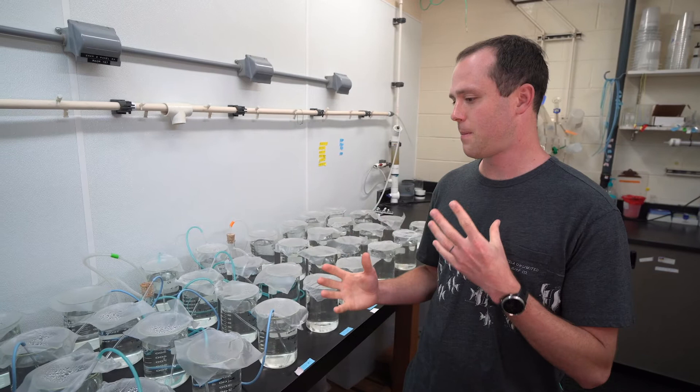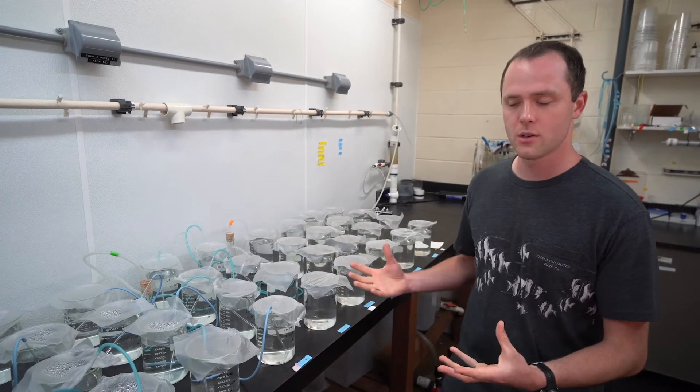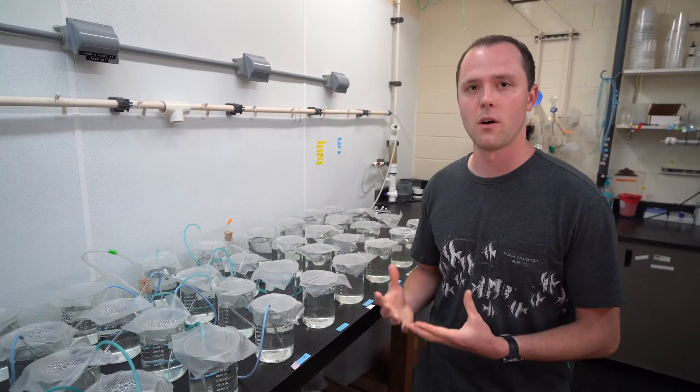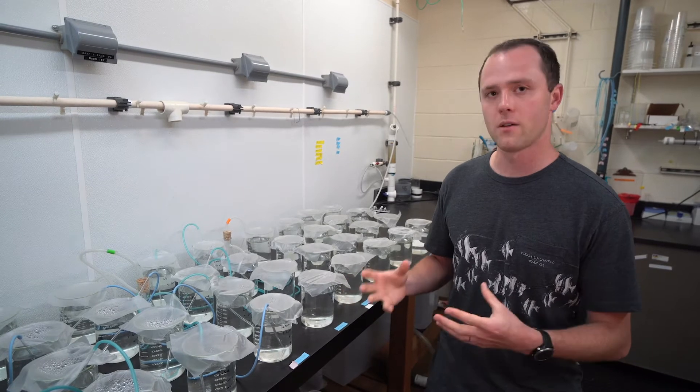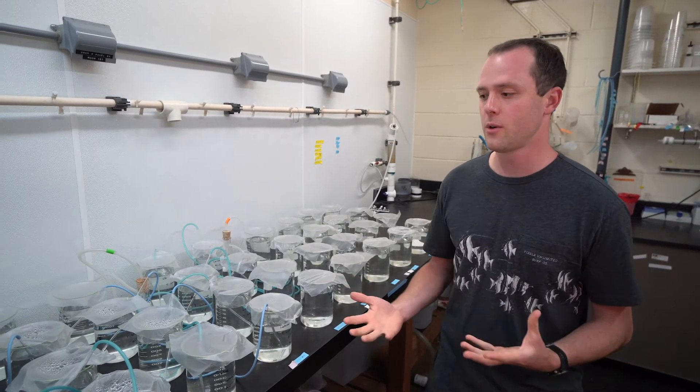So for this we're trying 1-liter beakers with and without aeration, because at this point the larvae are so small that in this volume of container the aeration actually causes quite a bit of turbulence.